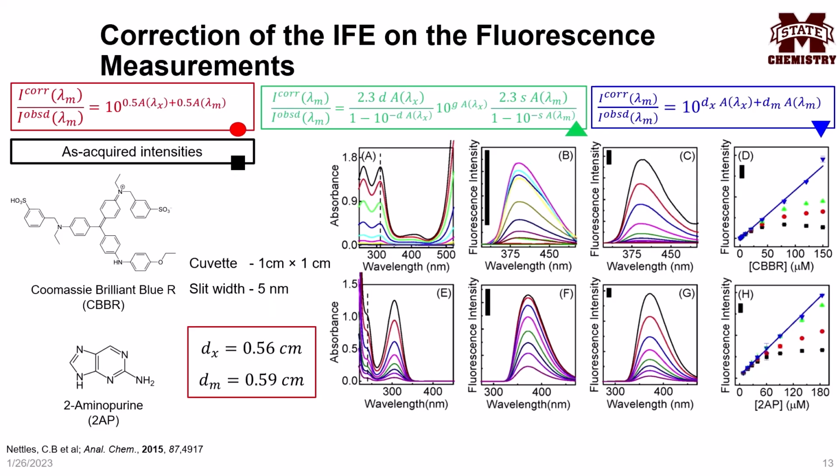Next, let's look at how the effective path lengths obtained with water Raman measurements are directly applied for real-life fluorescence inner filter effect correction. The fluorescence spectra are acquired with the same spectrofluorometer under the same instrumental configuration. Here, we have used two model fluorophores, Coomassie Brilliant Blue R and aminopurine.